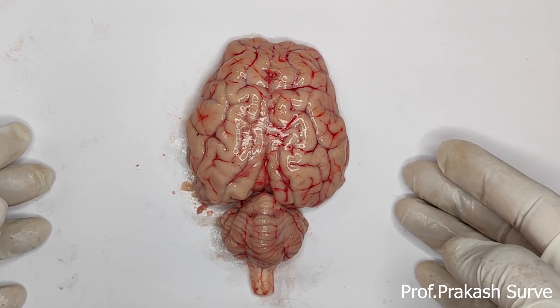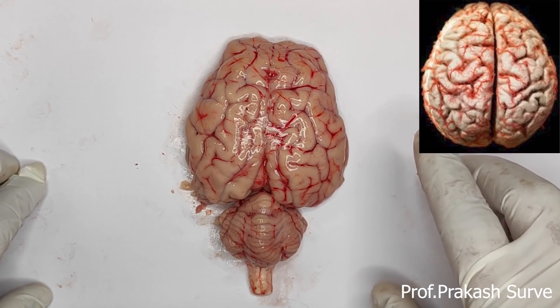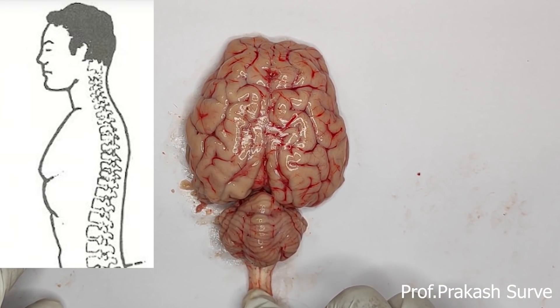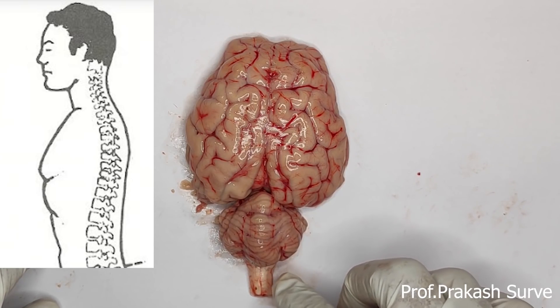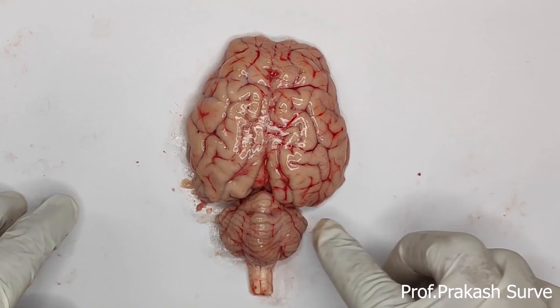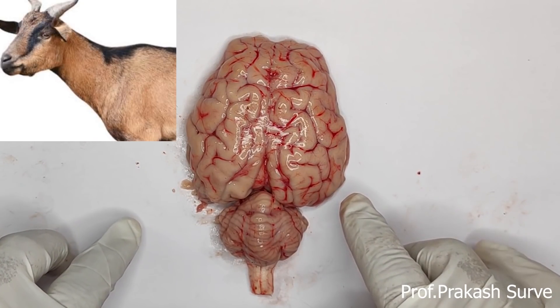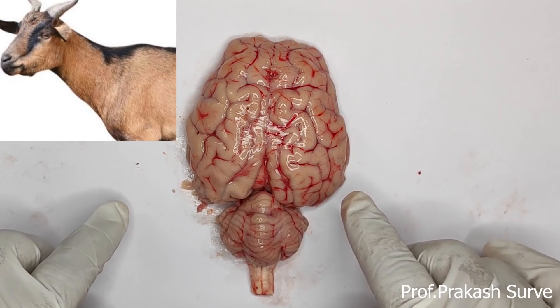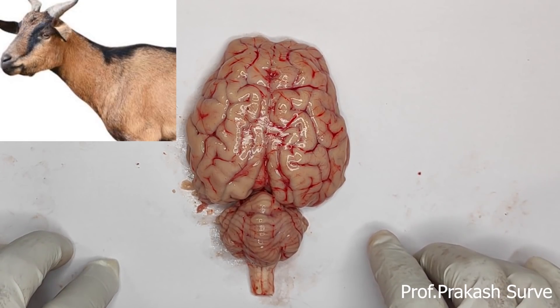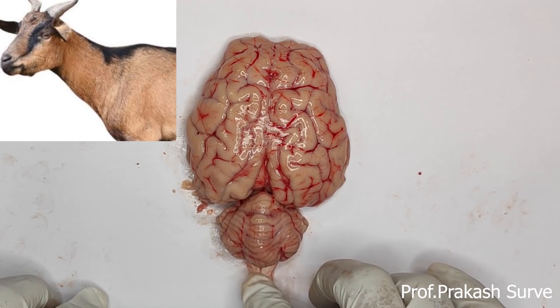This is a goat brain. We chose it because it has similar parts to the human brain. The first difference is that in the human brain, the brain is rounded and its stem points downward and vertically, as humans stand erect. In the case of the goat, the brain is elongated and the stem goes outward, horizontally, since the goat walks on four legs.